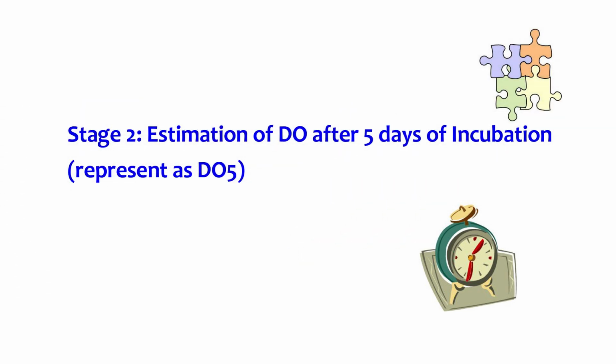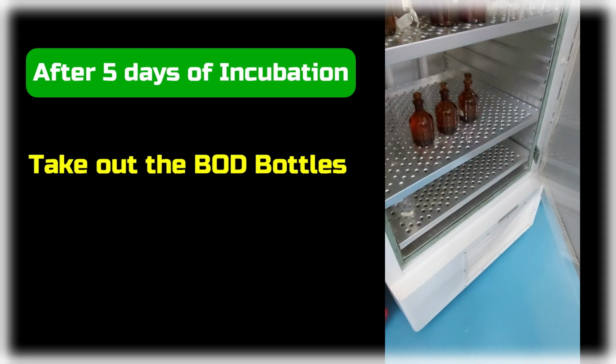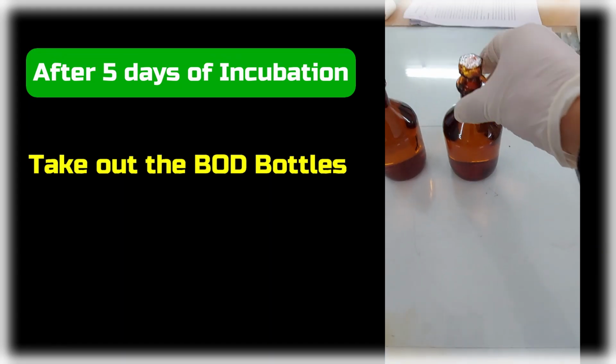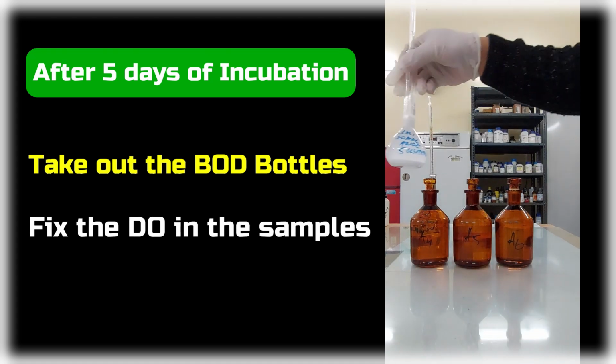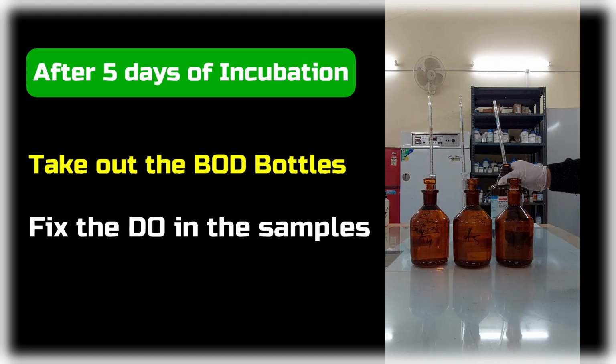Next, let's move on to the next stage, which is the estimation of the dissolved oxygen after the samples have been incubated for 5 days inside the BOD incubator. To start this stage, first take out the BOD bottles and then proceed with the analysis by first fixing the dissolved oxygen present inside the BOD bottles.